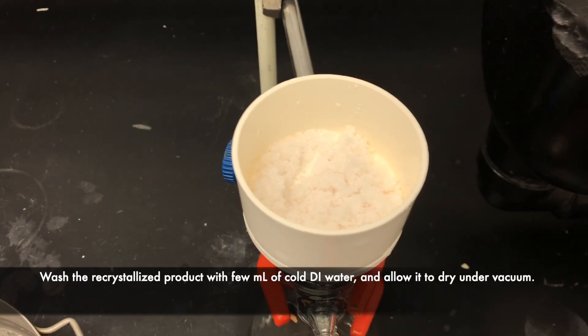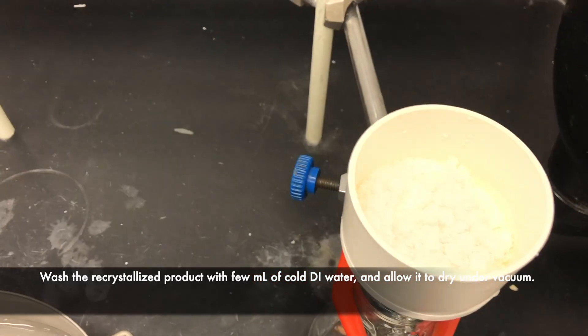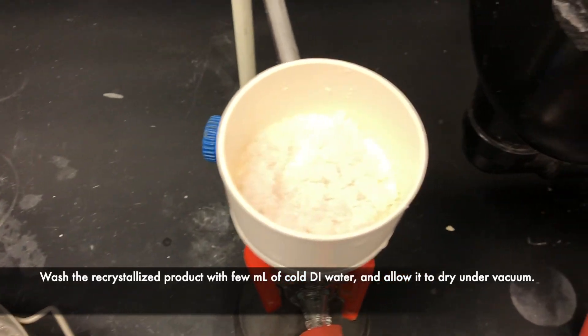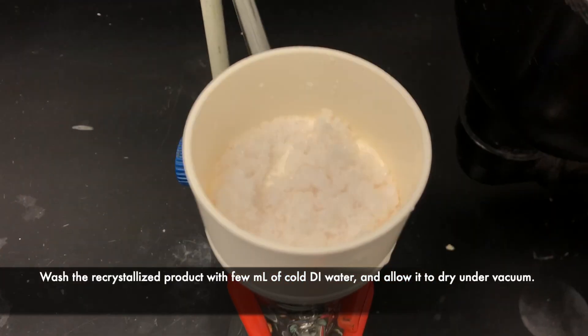Now that we have our recrystallized product, we'll allow it to air dry under vacuum for about 15 minutes.